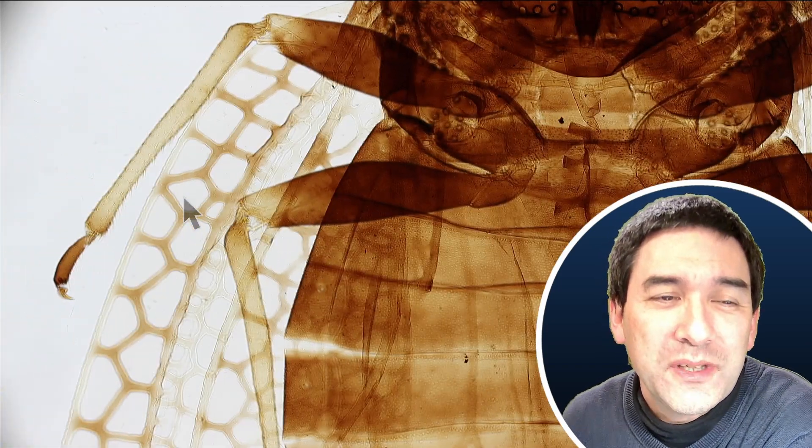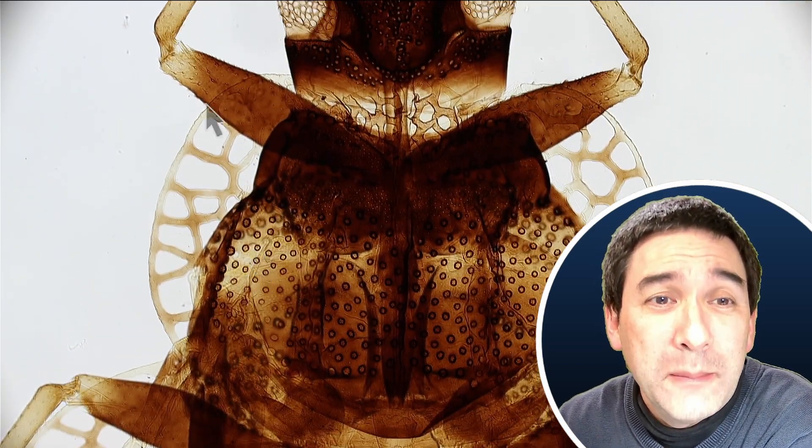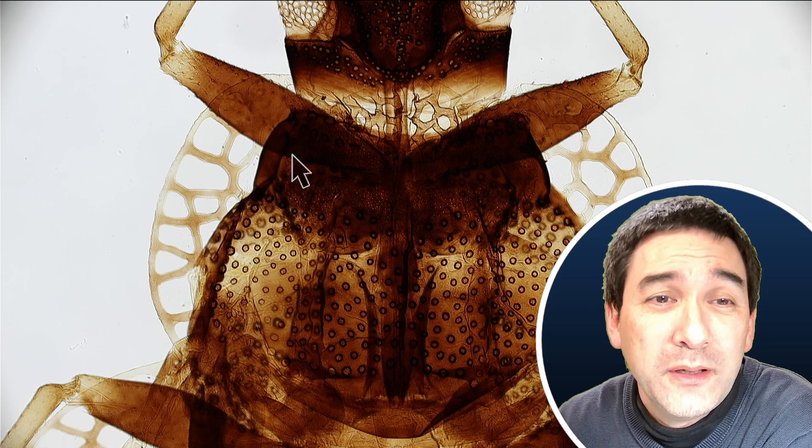And also look at this — how many pairs of wings does it even have? Is this actually one pair of wings here? It's in a very strange position. And over here in the back we've got the second pair of wings. Two pairs of wings is nothing unusual, but what I consider a little bit confusing is the rather unique position of this smaller wing pair here in front.